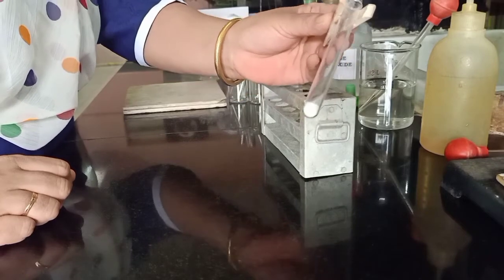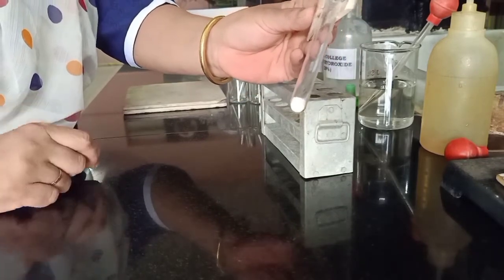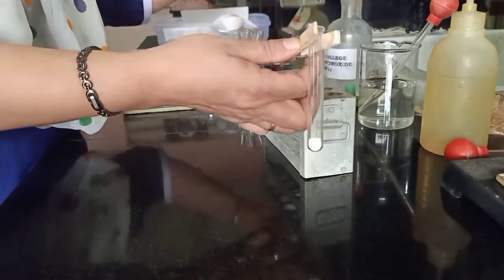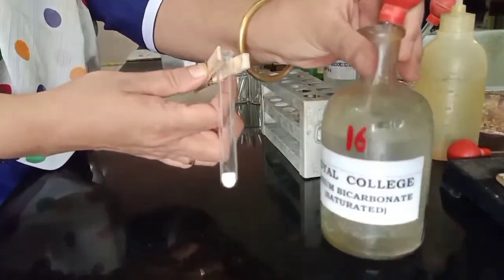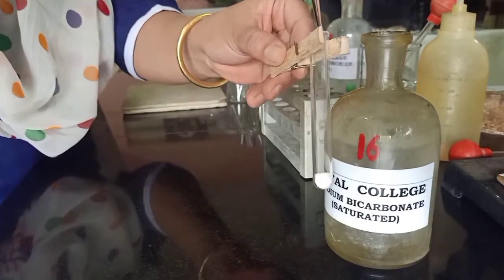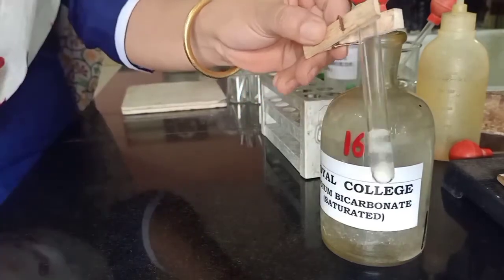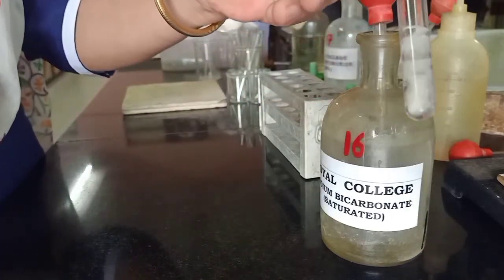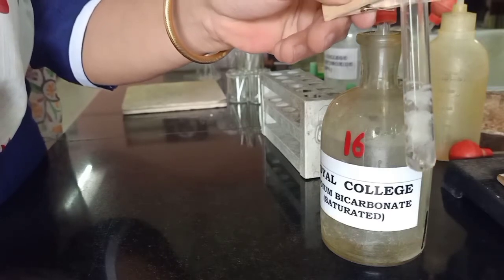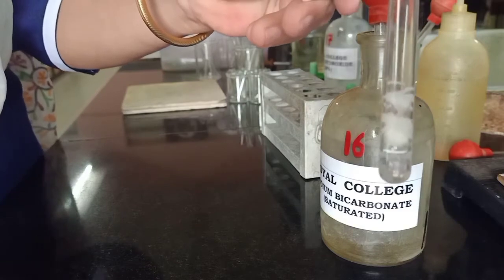First we need to check for type. In the type sequence, the first test is for an acid. An acid is tested for with bicarbonate. So let's add bicarbonate to this and check for effervescence. As you can see, there is very brisk effervescence taking place, indicating that we may have an acid present.